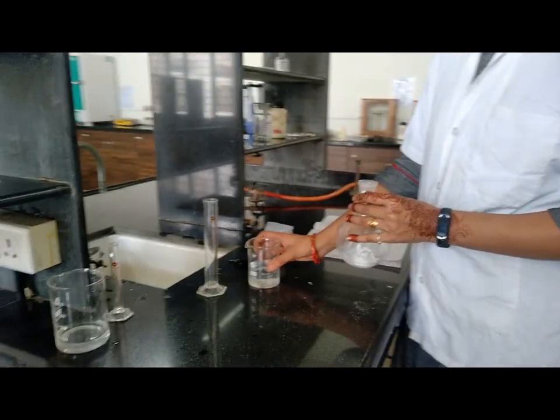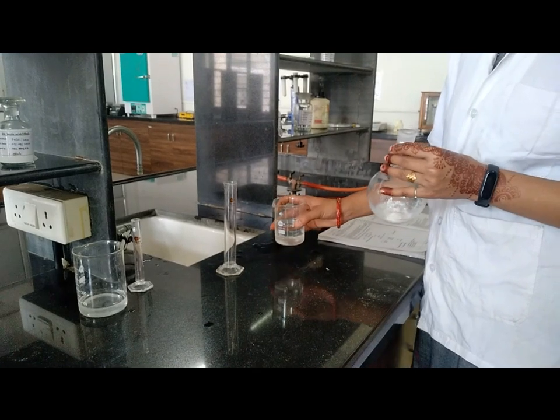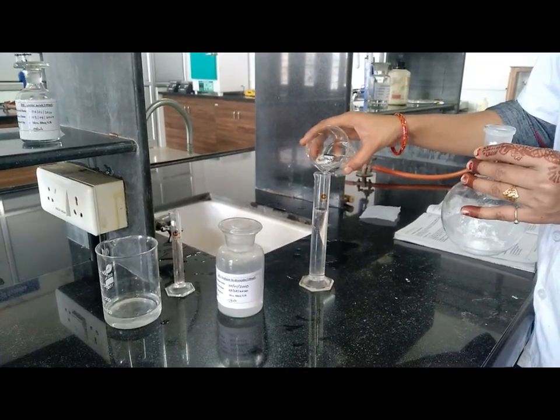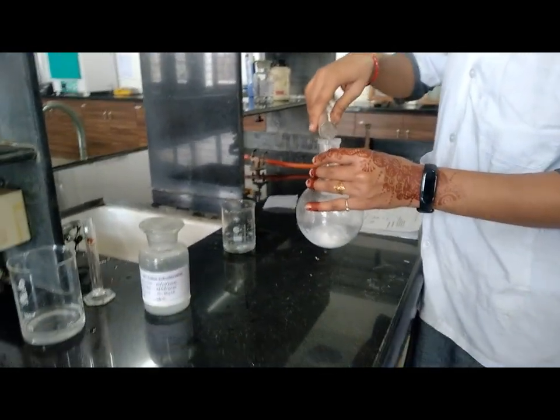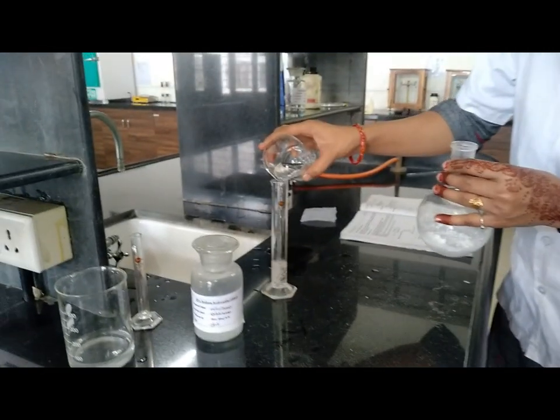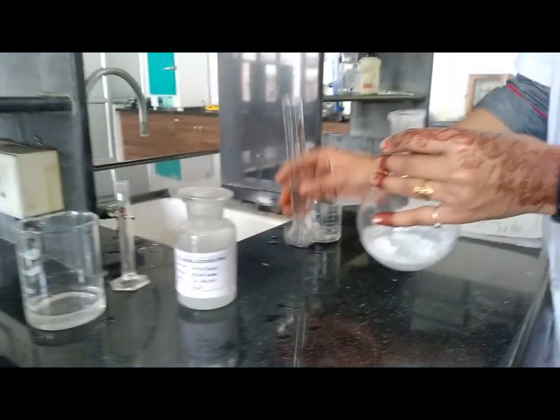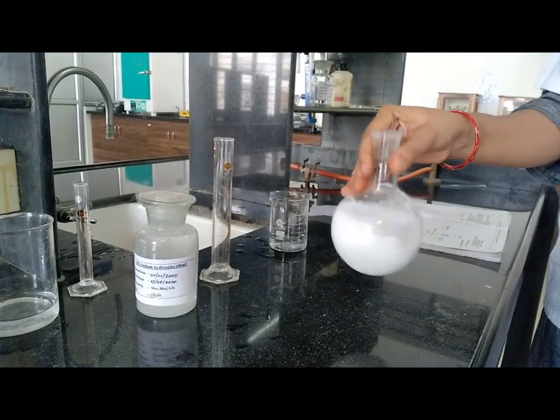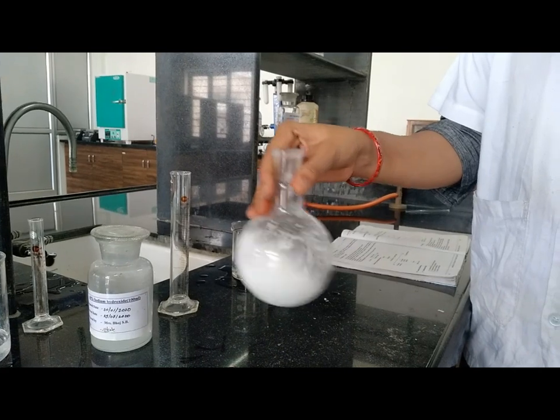Now this is the freshly prepared sodium hydroxide solution. Take 75 ml of sodium hydroxide solution. This is 50 ml, and now 75 ml of sodium hydroxide solution.